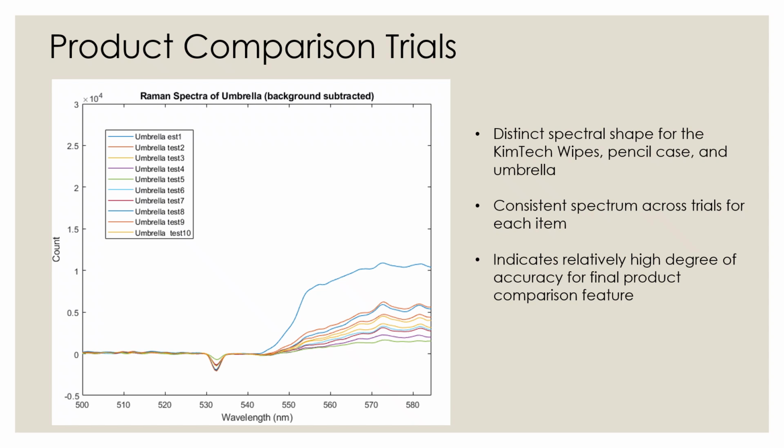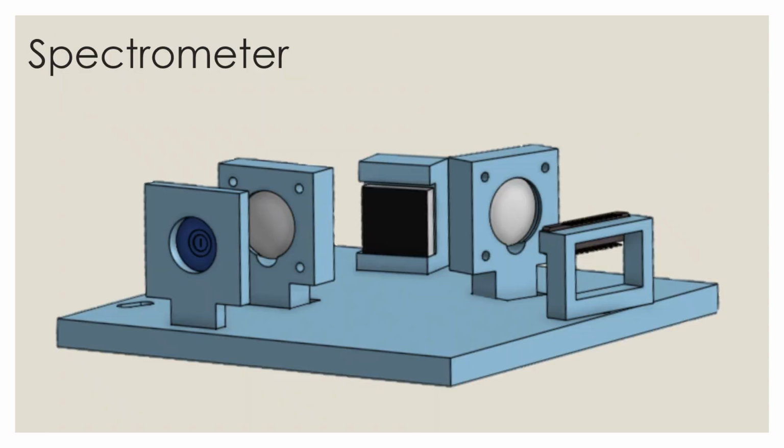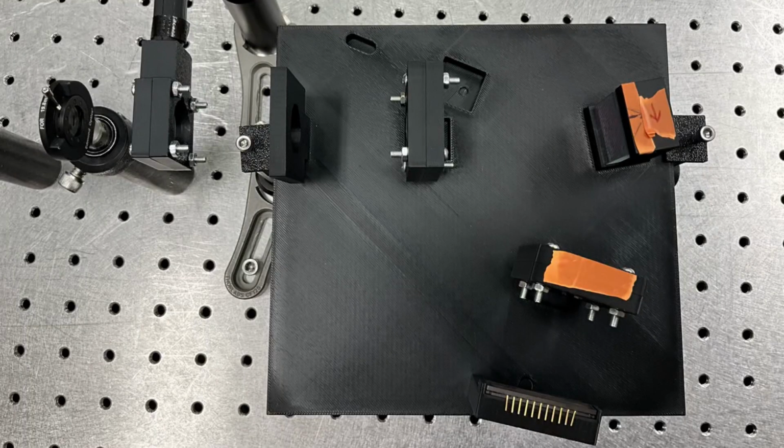The spectrometer portion of TEX-RAY is responsible for separating the Raman signal from the probe optics into its constituent wavelength components. This is a prototype for the reflective spectrometer configuration used in our system. For the prototype, we're using a 50mm plano-convex lens to couple light into the spectrometer. This is okay for testing purposes, however, I must note that in the integrated setup, a 75mm achromatic lens will focus the Raman signal onto the entrance slit of the spectrometer.